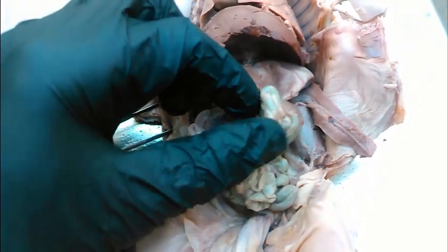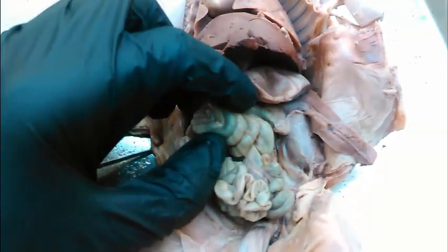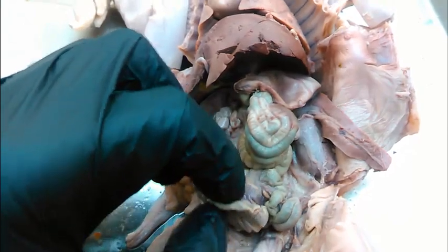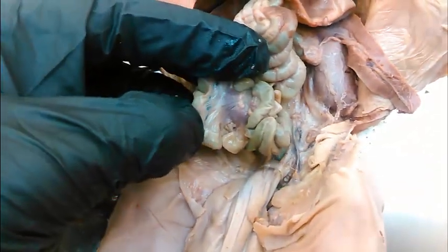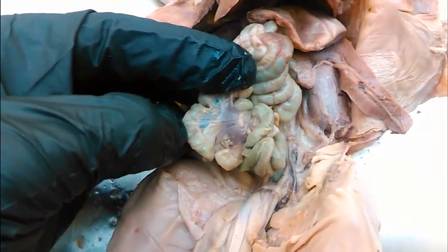Back up and away a bit — what is this big spirally looking thing? That again is the large intestine, or in the pig, the spiral colon. What is this? All of this stuff over here — that is small intestine. And that membrane attached to the small intestine — what is that? And that again is mesentery.